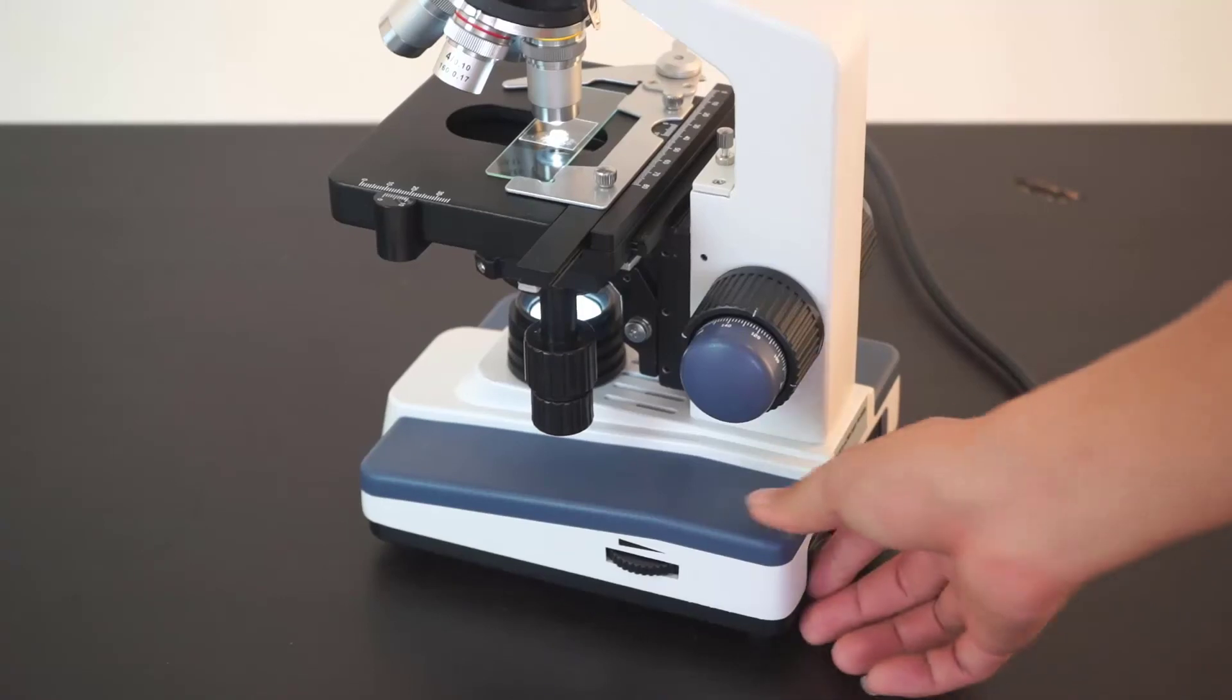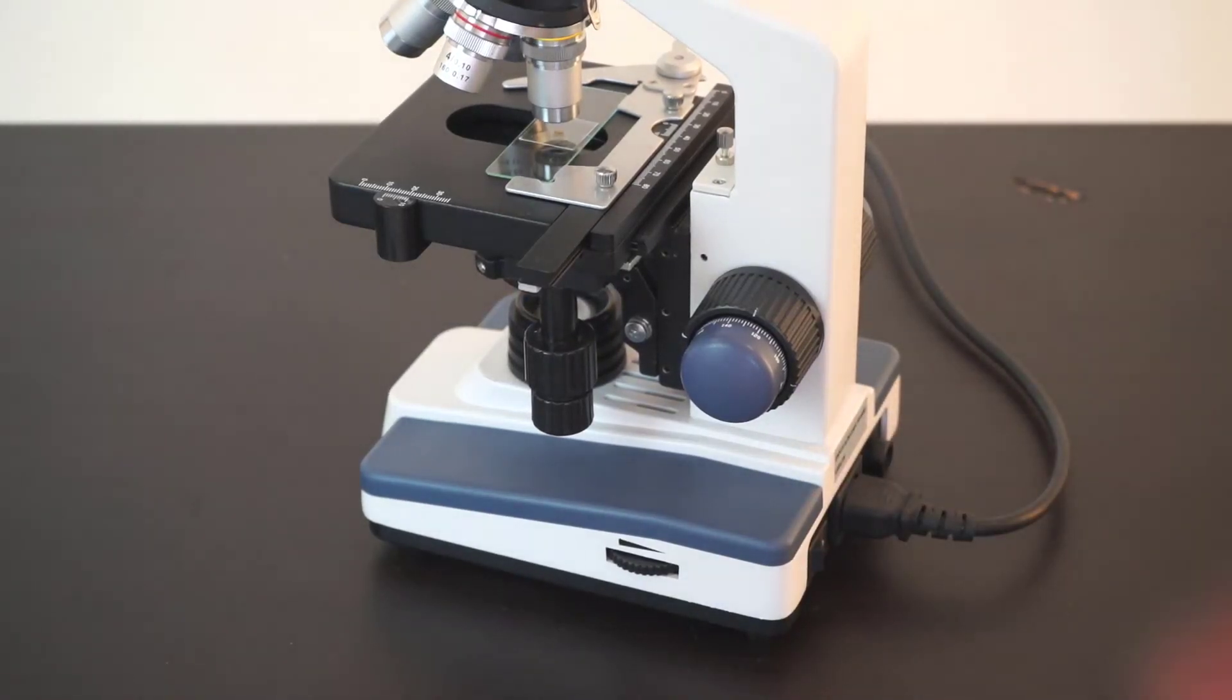Once you have finished using the microscope, always turn off the light. Next, cover the microscope with the dust cover.